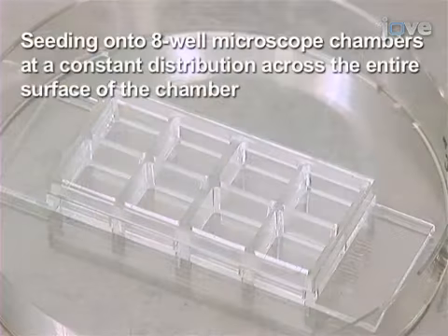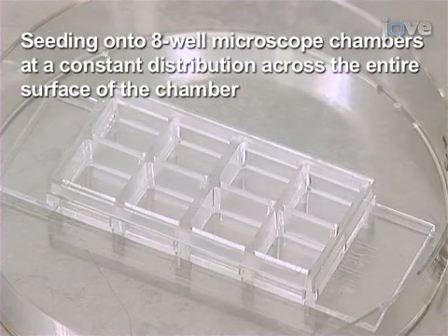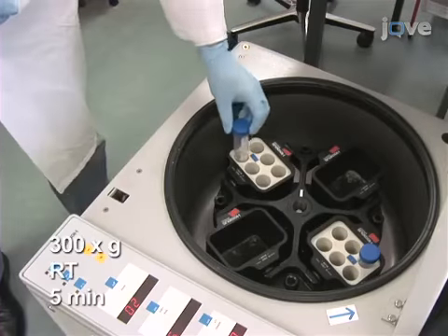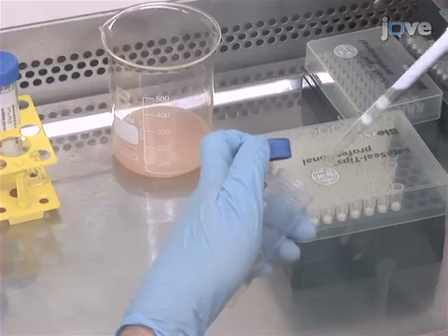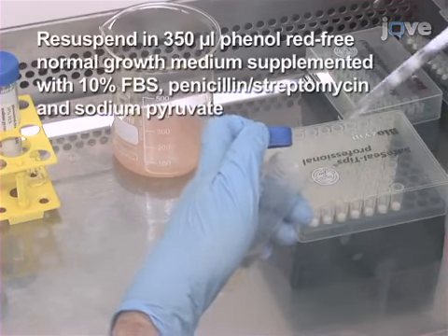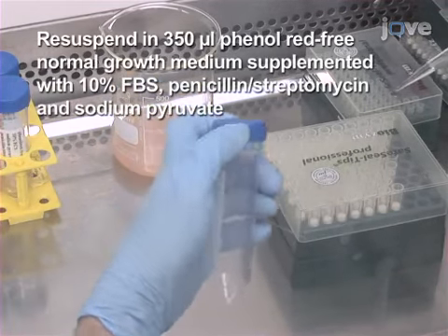For seeding of cells onto 8 well microscope chambers at a constant distribution across the entire surface of the chamber, centrifuge 10,000 cells and resuspend in 350 microliters of phenol red-free normal growth medium.